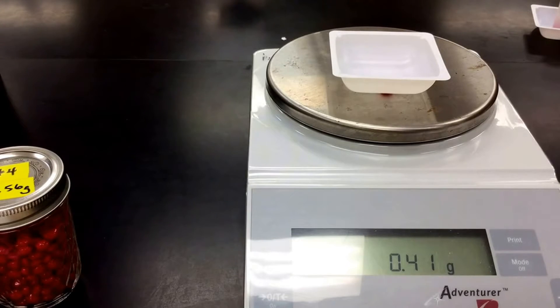So if I took maybe five of our red hots — I'm going to add four to this — I'm going to come up with another conversion factor, which is: for every five red hots, the mass is going to be about 1.83 grams. And that's going to be a conversion factor that you can use. So what we'll do next is we'll show you how you can use that conversion factor to figure out how many red hots are in that jar.